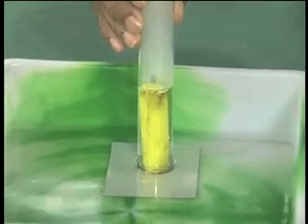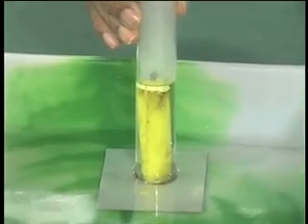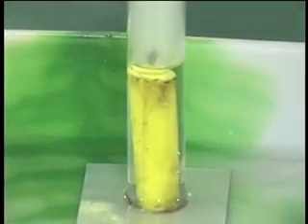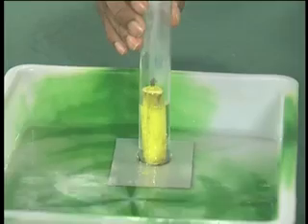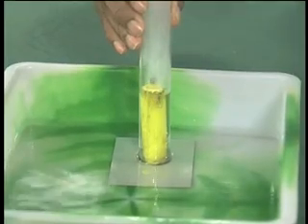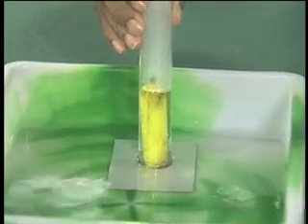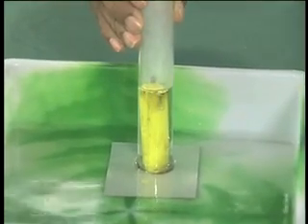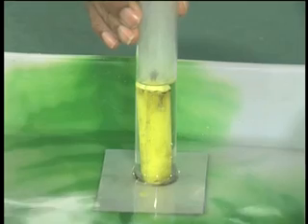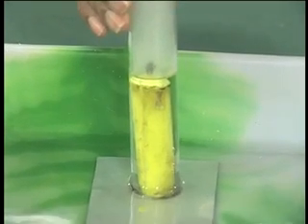When all the oxygen has been used up, the candle goes out. The space that was previously occupied by oxygen now becomes free and hence water rises up the glass tube.